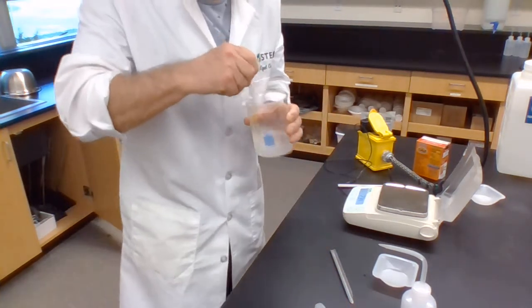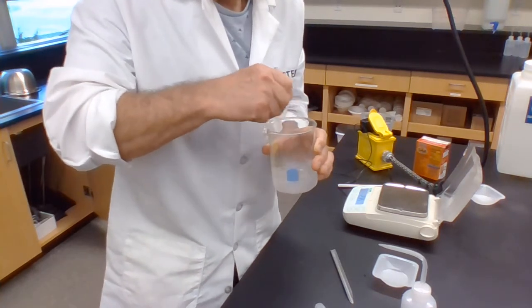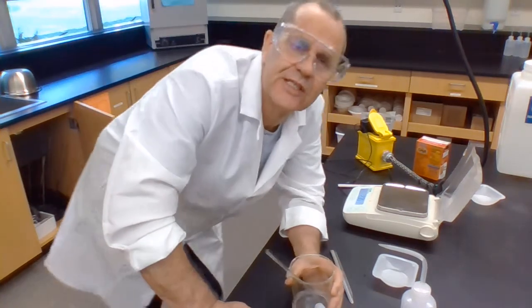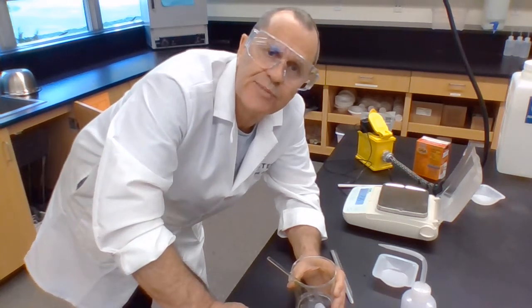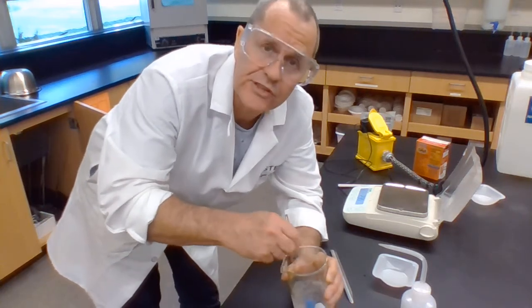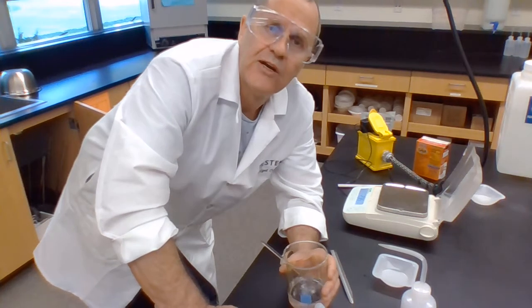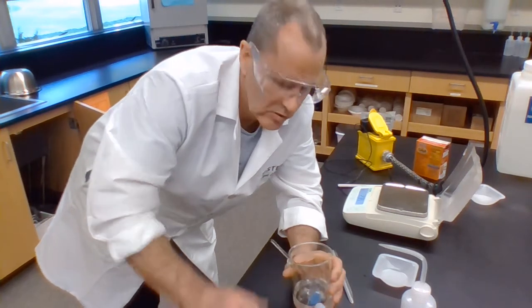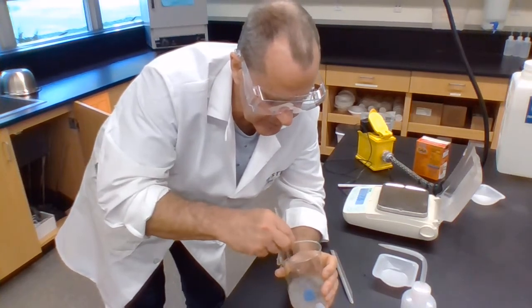So I keep stirring it, and I keep stirring it until it stops fizzing. I'm not fizzing. And it's still fizzing. So there's more to react. Now, one of those reactants, citric acid or sodium hydrogen carbonate, is in excess. But I don't know which one because I didn't measure it out carefully. So what you'll have to do is work out how many moles of each of these reactants I've put in here, which one is in excess, and how much there is of excess, whether in grams or moles, or obviously both. And then what I'm going to do is I'm going to use this Bunsen burner over here.